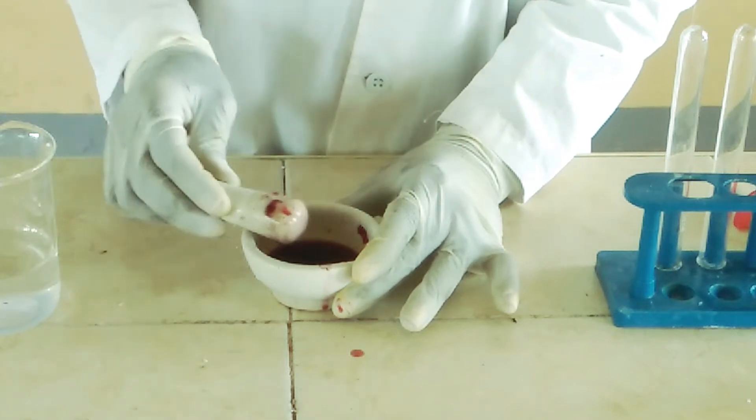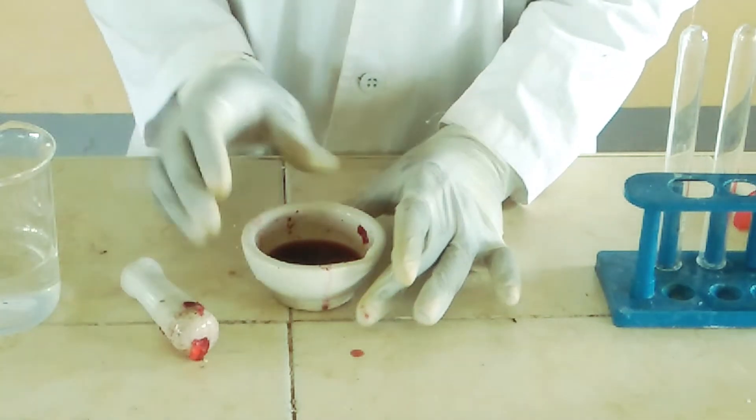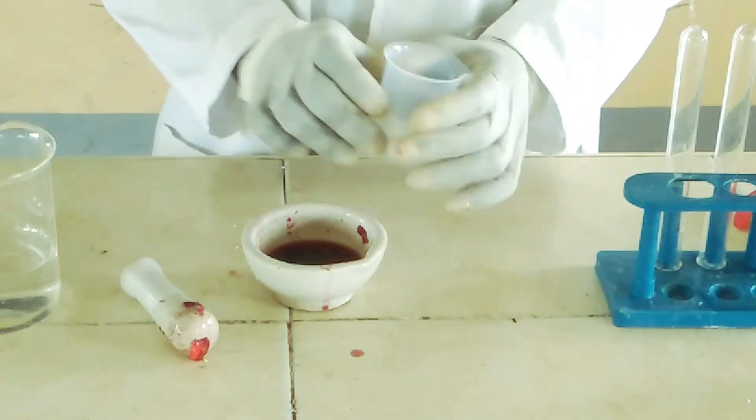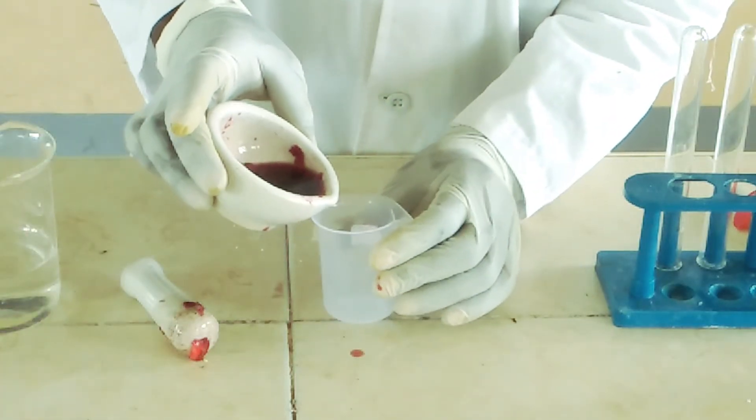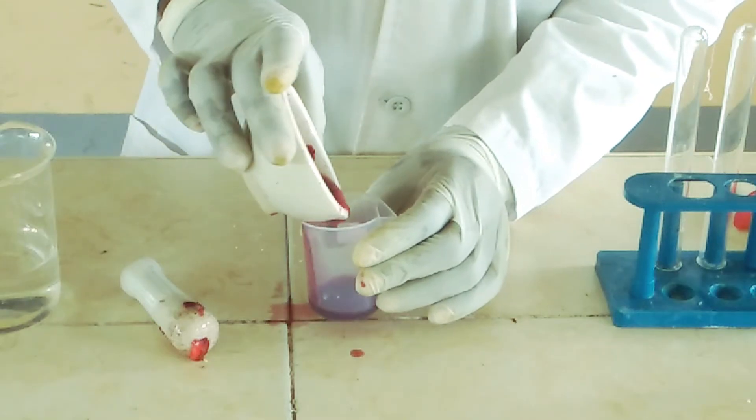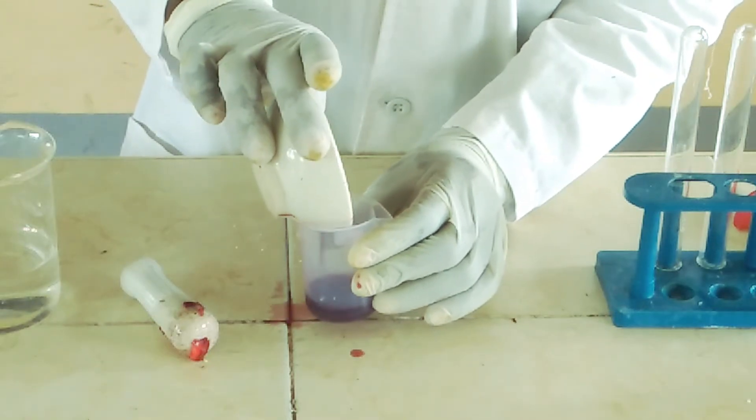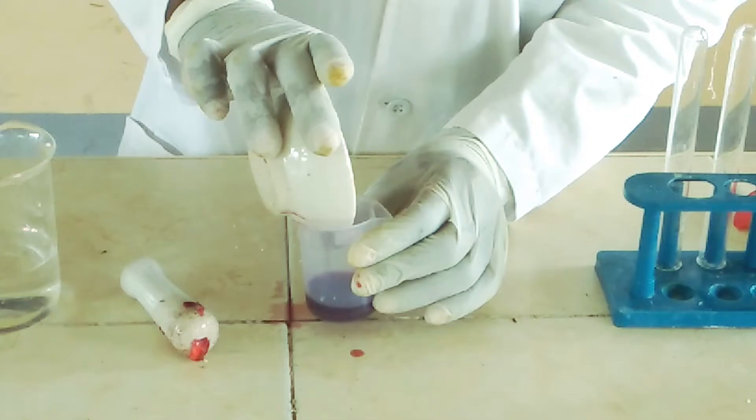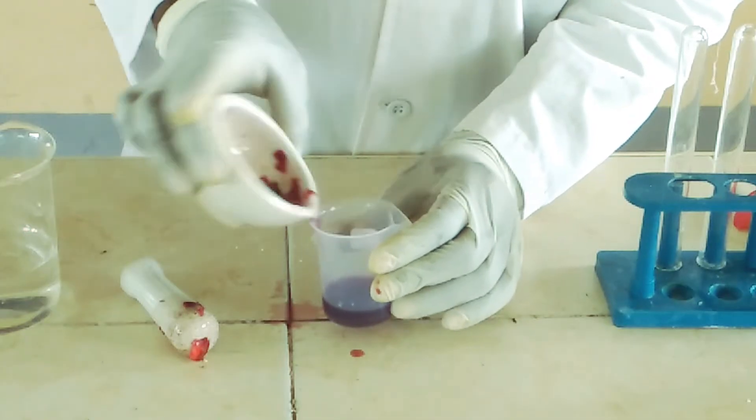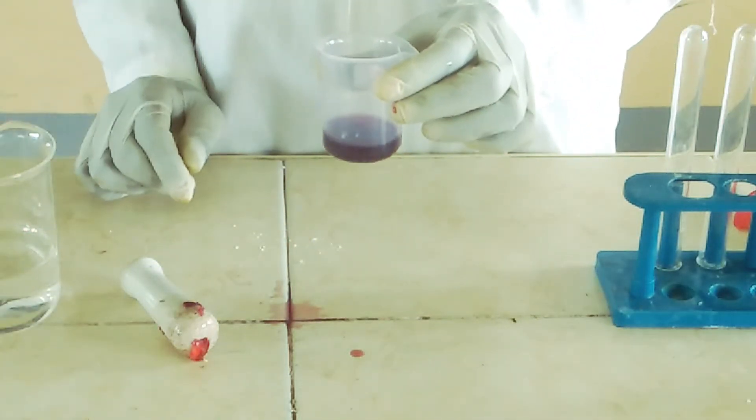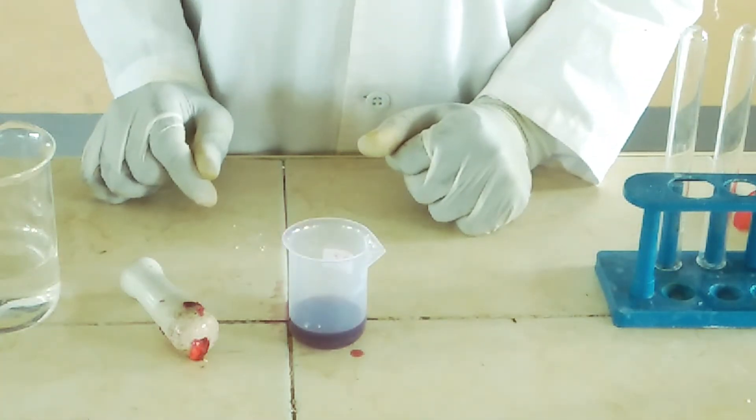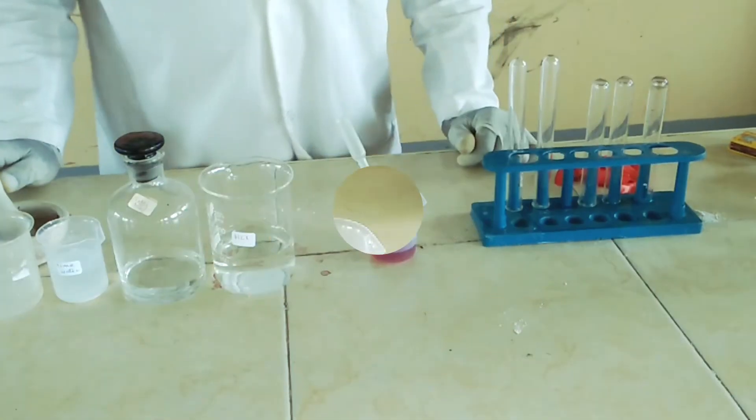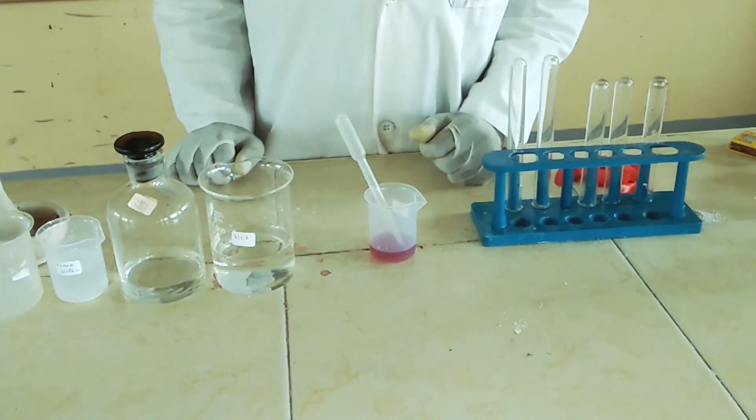I think my solution is ready. Then I'm going to decant the solution into a beaker. There you have it. We have prepared a simple acid-base indicator from flowers. You can also use leaves. Even leaves will give us the same extract.